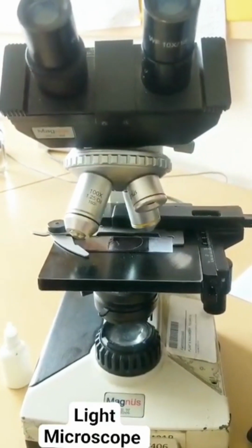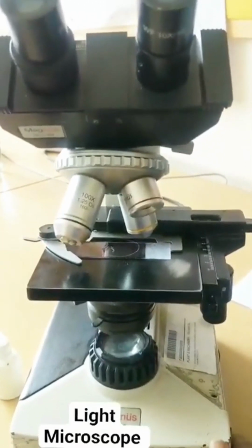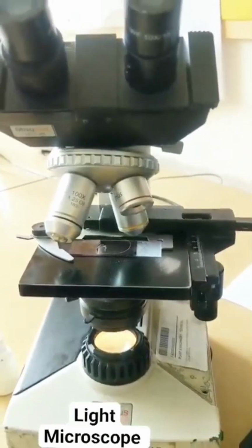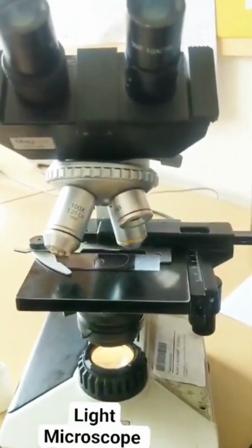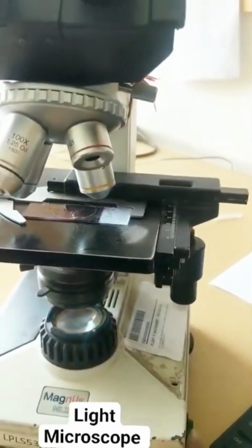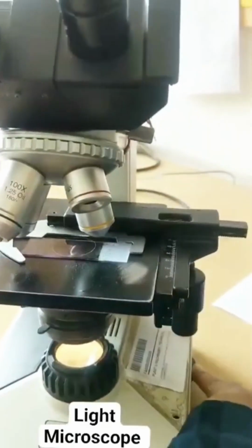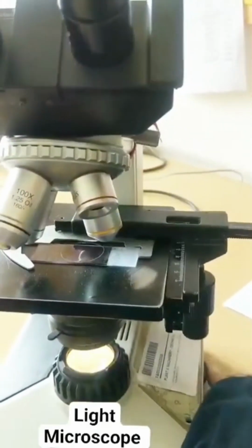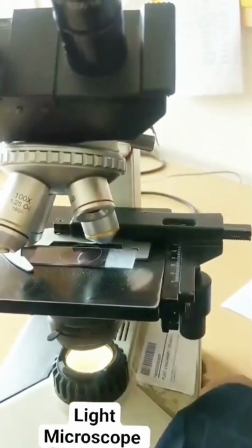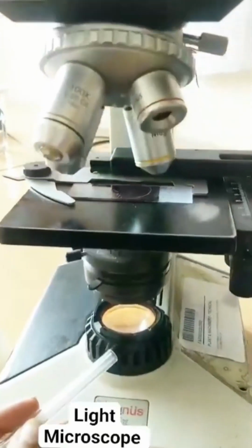So this is a light microscope that we've got, and the first thing that I want to show you is the light source. Do you notice that at the bottom there is a light source present over here? This is the knob with which I can switch the light on and off, and there's a regulator over here. I can adjust the amount of light that I would be needing. So number one, what do I have? First I have a light source.